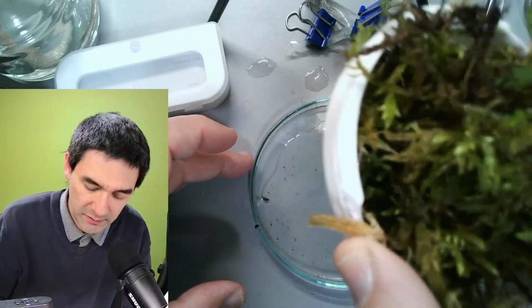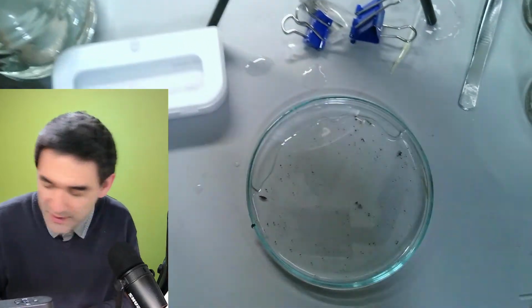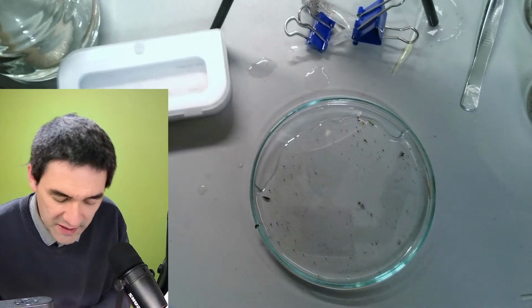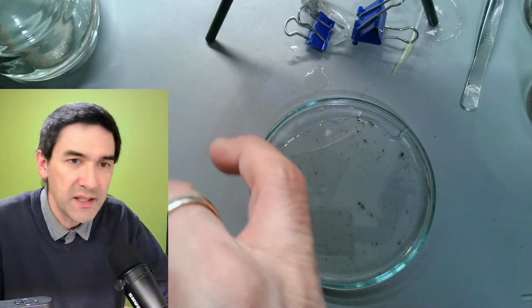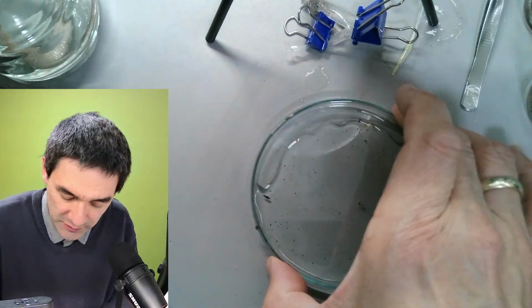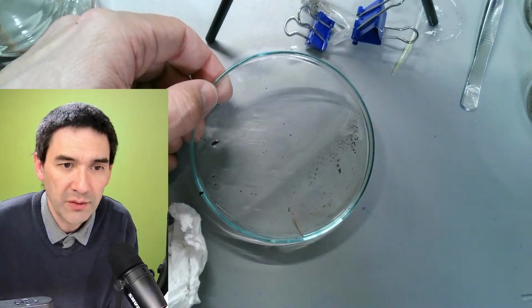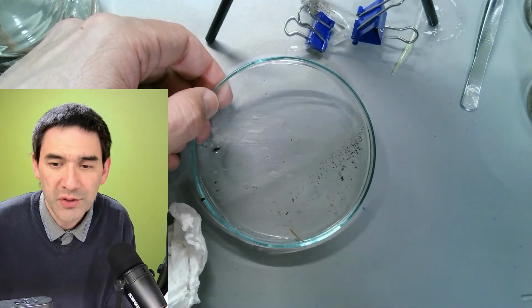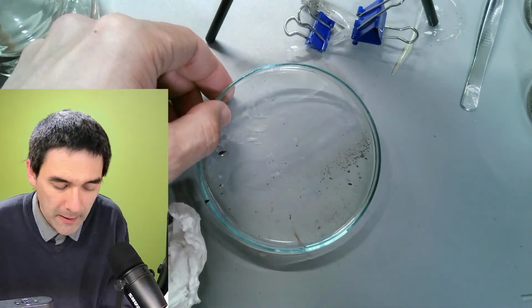I think one of the reasons why in the sciences and research they use Baerman funnels is because it is simply a standardized procedure. But I get it, of course, that this way you're also able to get out particles here. So that's just saying.